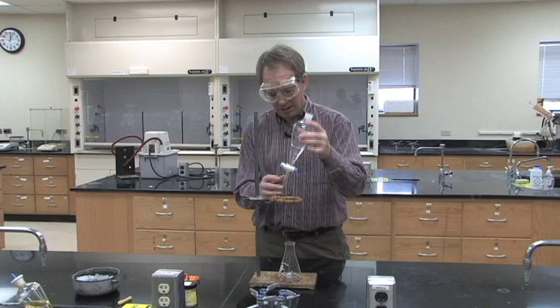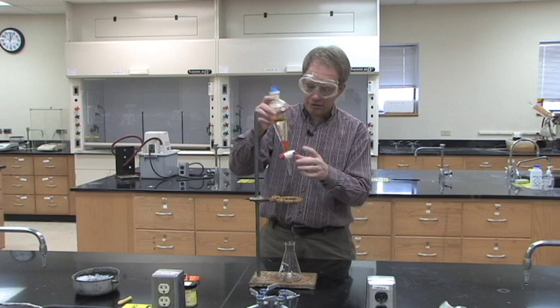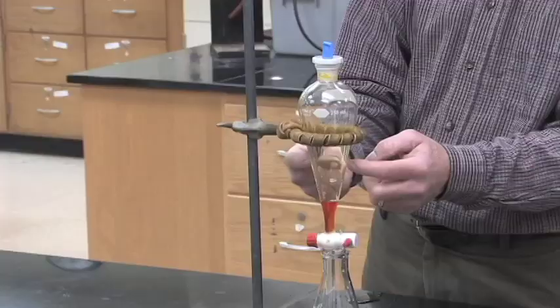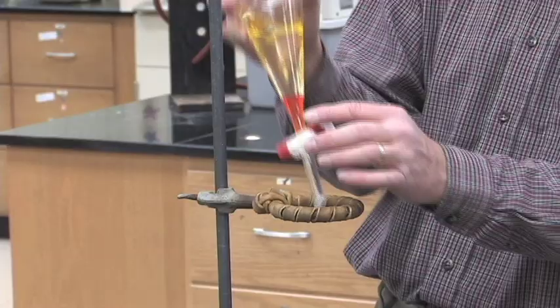You add your liquids and solid in, and when you do that it'll look like this where you have two very distinct layers — the bottom layer being the orange and the top layer being the clear layer.